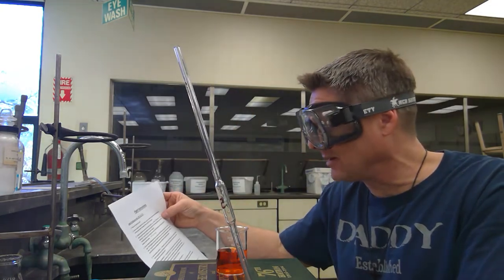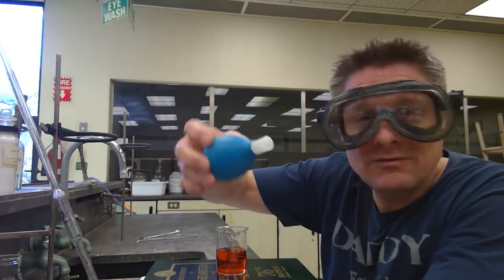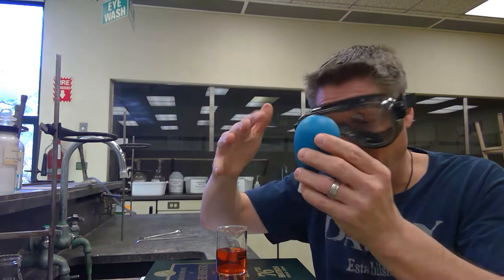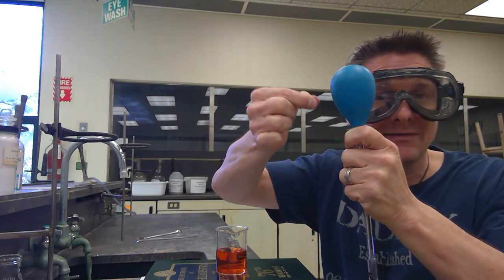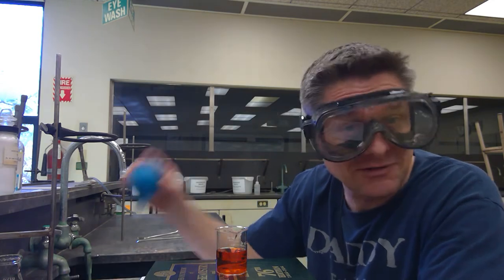Now the technique — it's kind of like using burets, there's a special technique and each one's a little bit different. We use the pipette bulbs in Chem 185. Chemists have to do things the hard way. If you're at a university or in biology, they probably have those fancier contraptions where you can just set it on top, press a little side button, and it'll suck solution up. If you let go, it holds it there; press another button, it brings it down. Those are a piece of cake and don't take much skill, but we're going to make you do it the hard way.